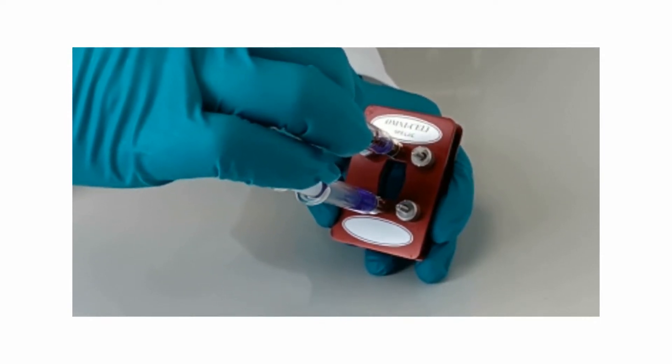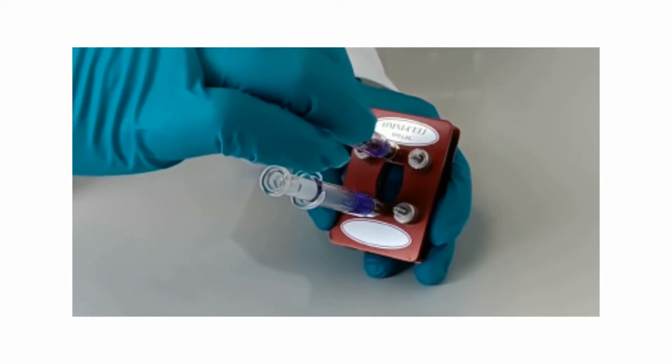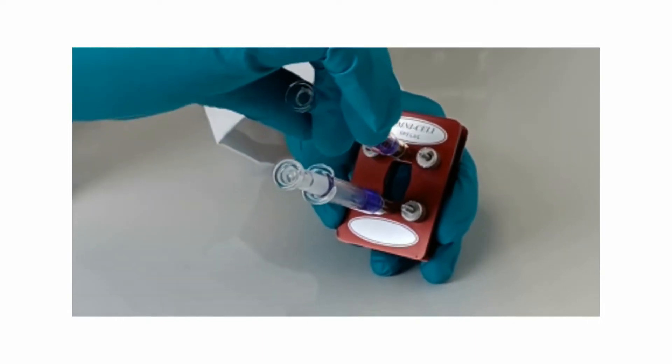This helps to prevent over-pressurization caused by pushing the sample through the cell, which may result in leaks.